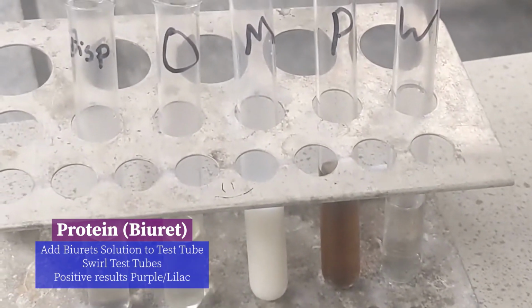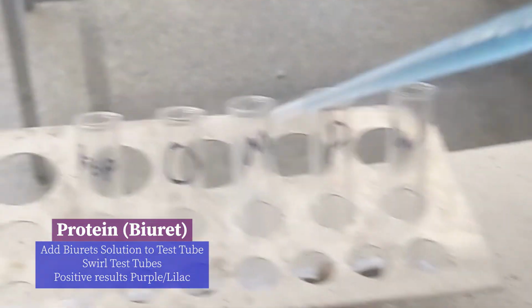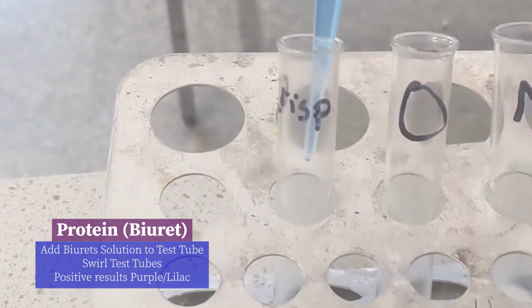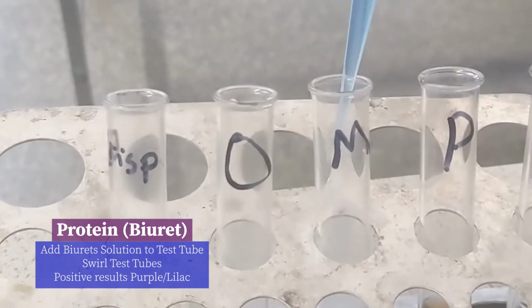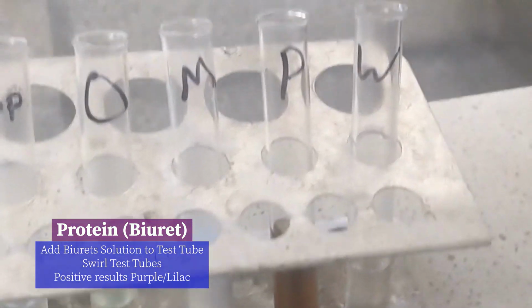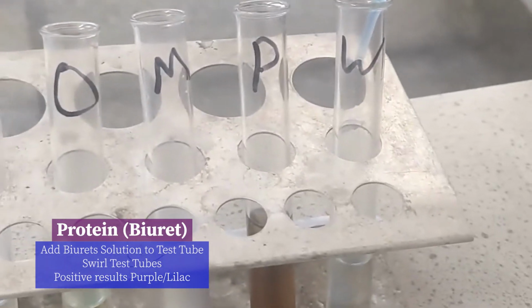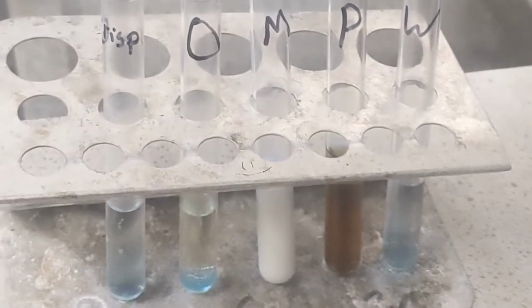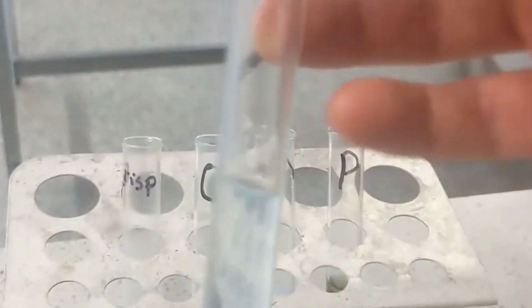Now, just like Benedict solution starts with a B and is blue, Biuret solution starts with a B and it's blue as well, right? Now for this one, we take our Biuret solution, we add it to the test tube where we already have our solution mixed up. If it stays blue, after we swirl it just a little bit, then it's negative.